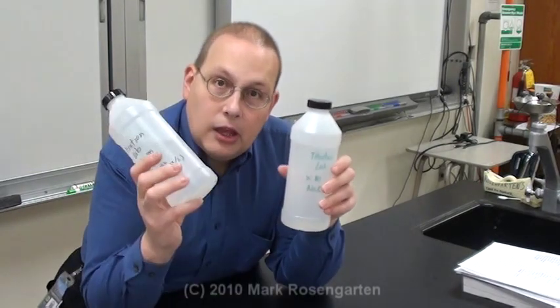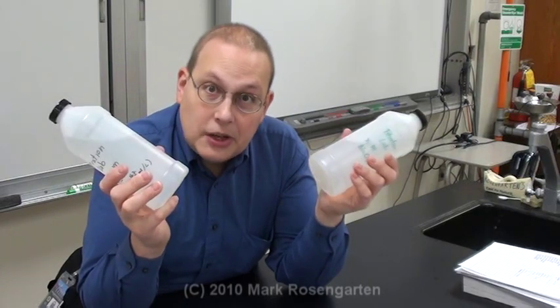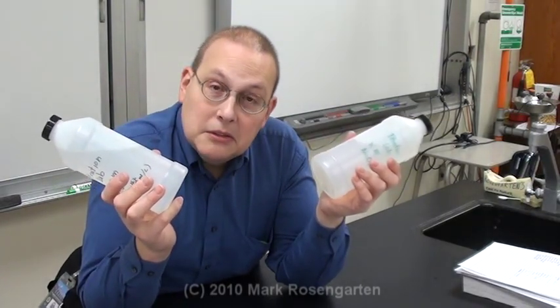We're trying to figure out MB. So what we do is find out the volume of acid, VA, and the volume of base, VB, and then just simply solve for MB. We're going to do this with a process called titration.